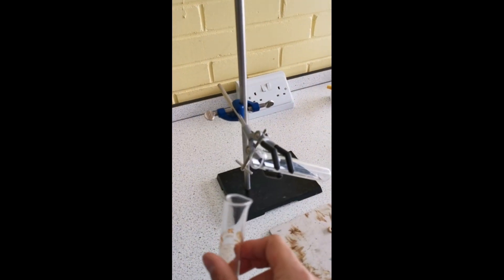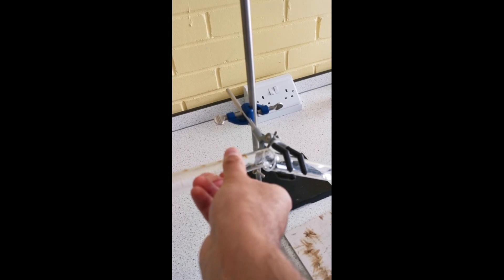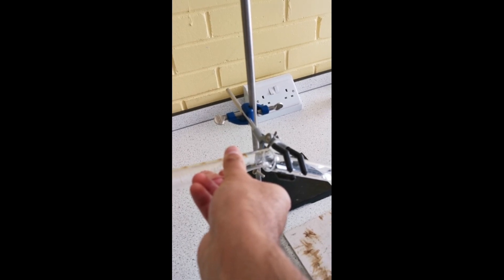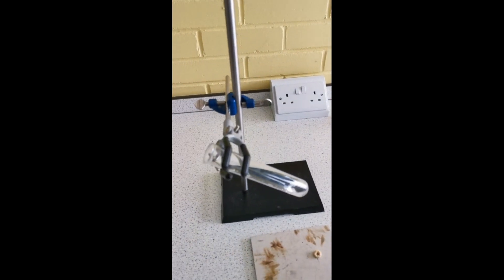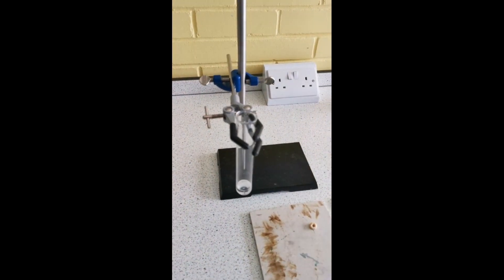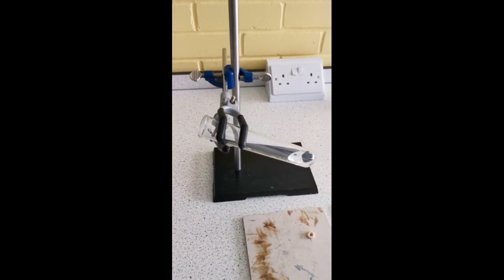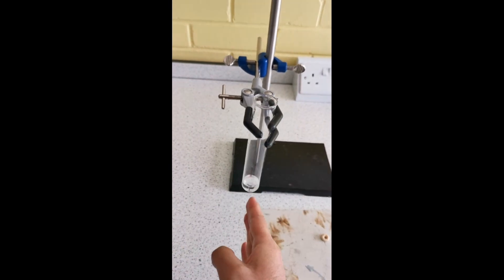I'm going to pour it into the boiling tube. Now, as you can see, the boiling tube isn't straight up like this, but I've tilted it to one side. That's important because if the heat was directly below it like this, you would burn the plastic on the clamp.